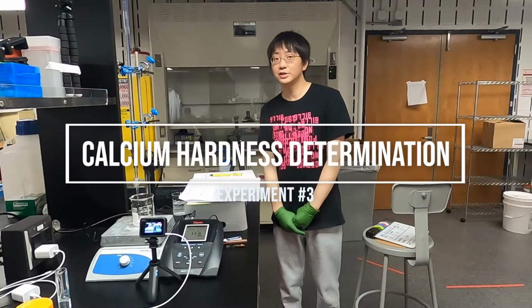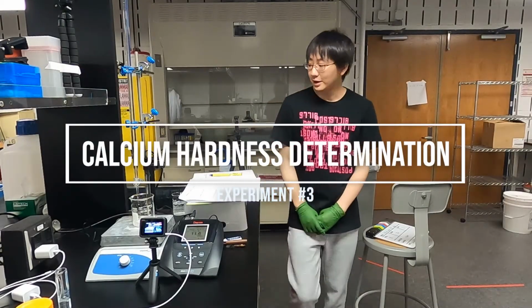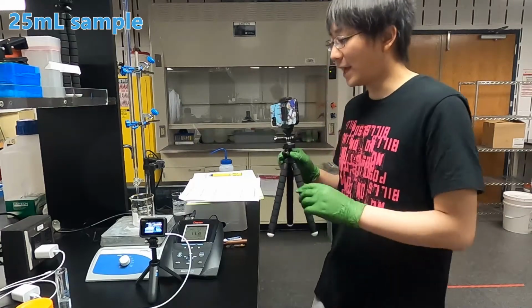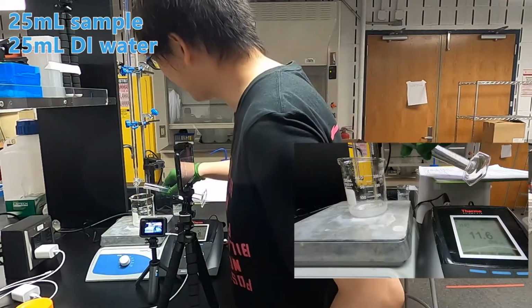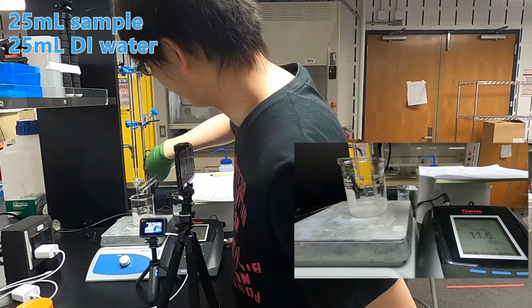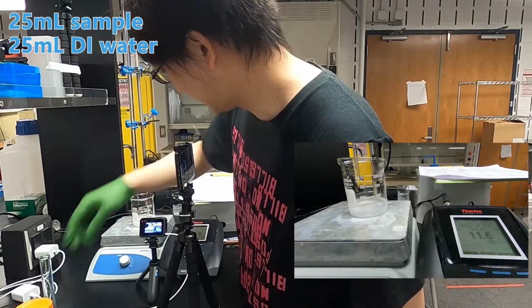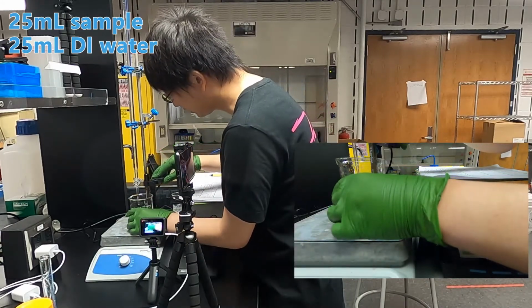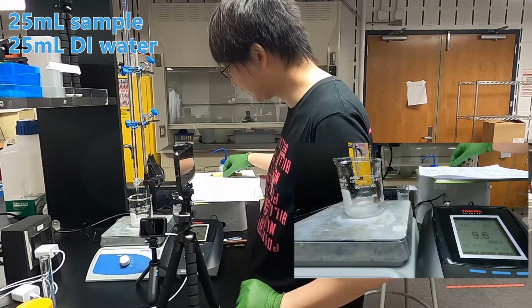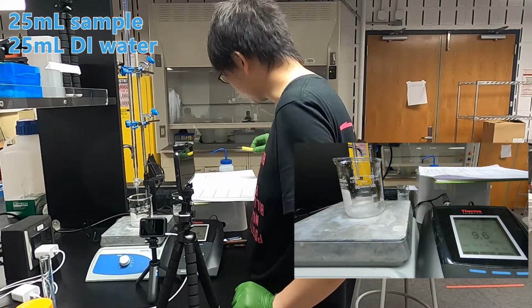So now let's measure the calcium hardness. So first, we add 25 mL of DI water into the sample. And then we measure the pH of the solution, and then we write down the pH of our sample.